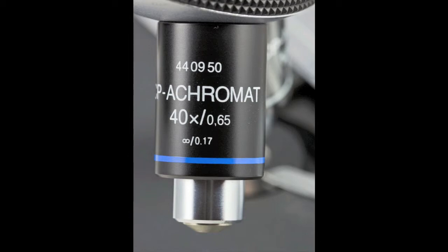You will also need to change the condenser to provide more intense light. You do this with the diaphragm lever as described previously.